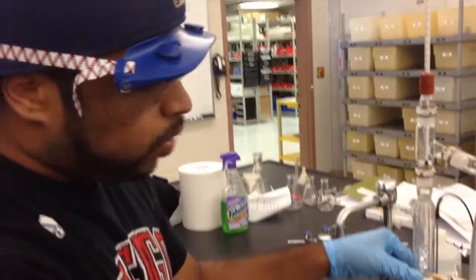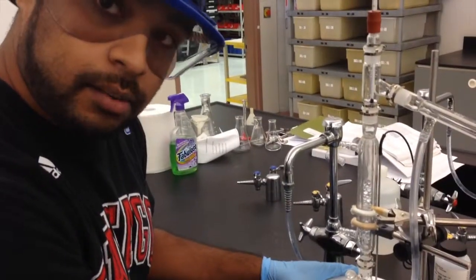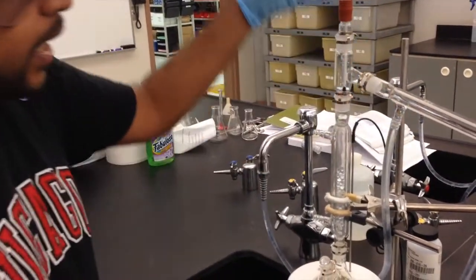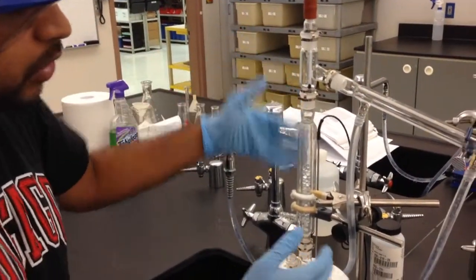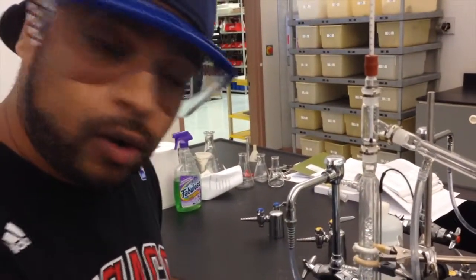Now, one run of this versus one run of that will give you a much purer sample in the fractional distillation versus the simple distillation. So this is why this technically is the same thing, but this just gives you a more efficient, more proper way of doing it instead of having to run the sample over and over and over again.